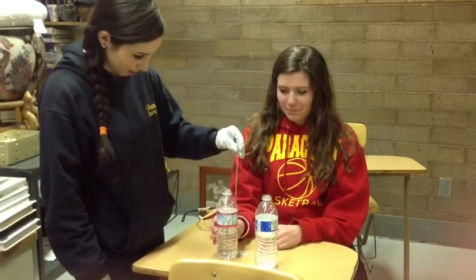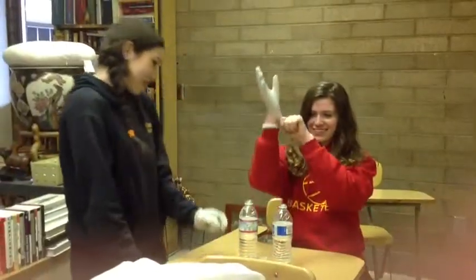Don't forget, chemicals can burn. To avoid this, wear your gloves at all times.